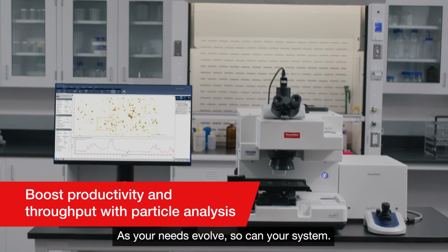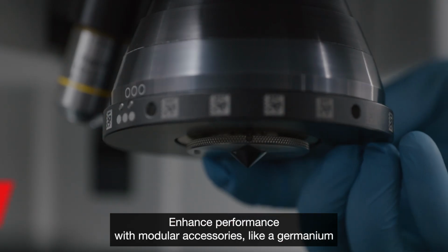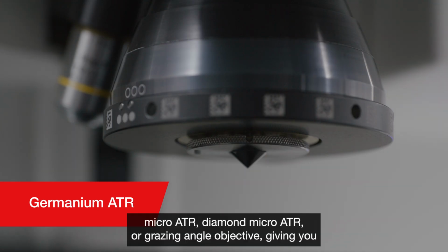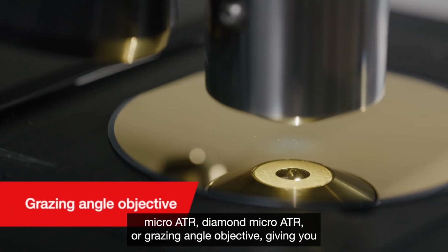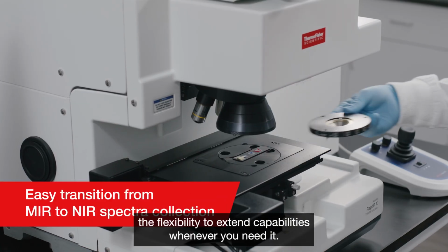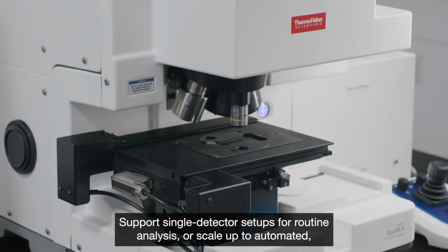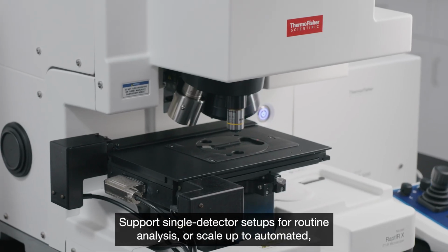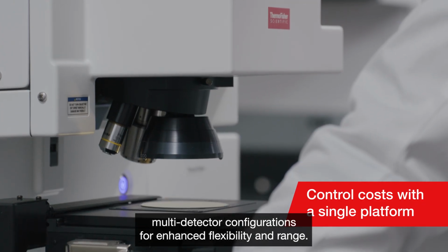As your needs evolve, so can your system. Enhance performance with modular accessories like a germanium micro ATR, diamond micro ATR, or grazing angle objective, giving you the flexibility to extend capabilities whenever you need it. Support single detector setups for routine analysis, or scale up to automated multi-detector configurations for enhanced flexibility and range.